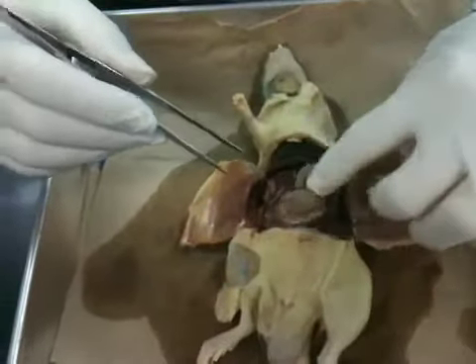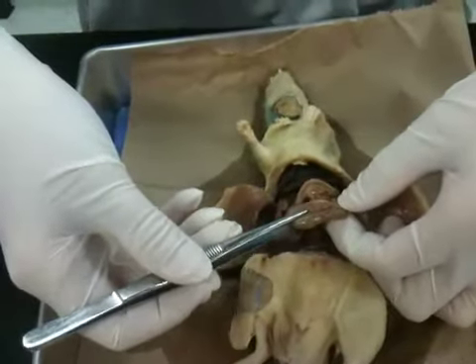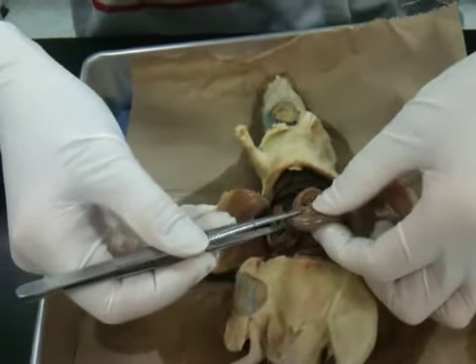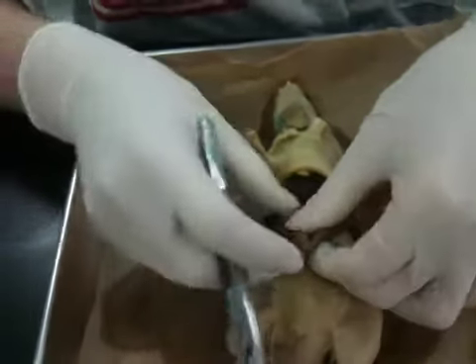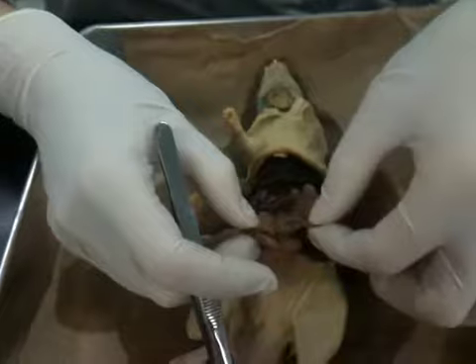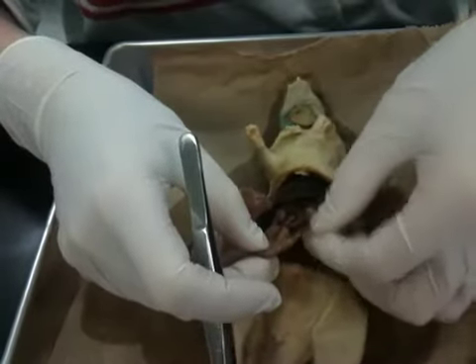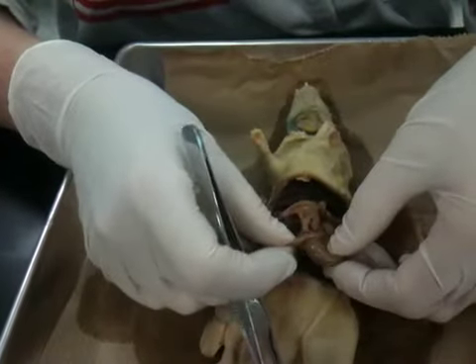In order to find the ileum, which is the third part, you have to find the cecum first. That's the pouch. Special note, do not open the cecum. The cecum's job is to store what's left over. We don't want to smell that. So we need to find the two different areas of what's coming in and out of the cecum. You will see that we have this piece and we have another piece off to the side. The smaller piece usually is the ileum. The larger piece coming off the cecum is the ascending colon.